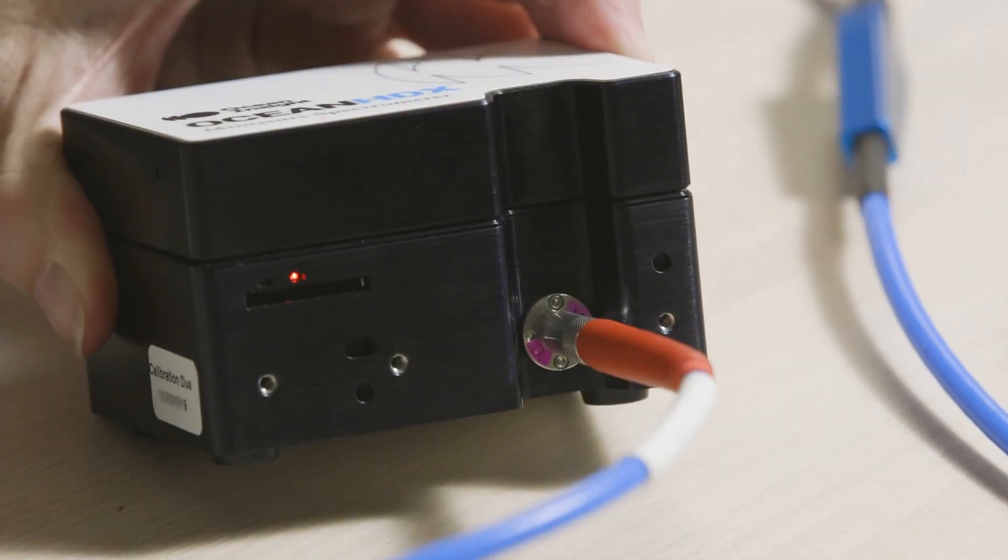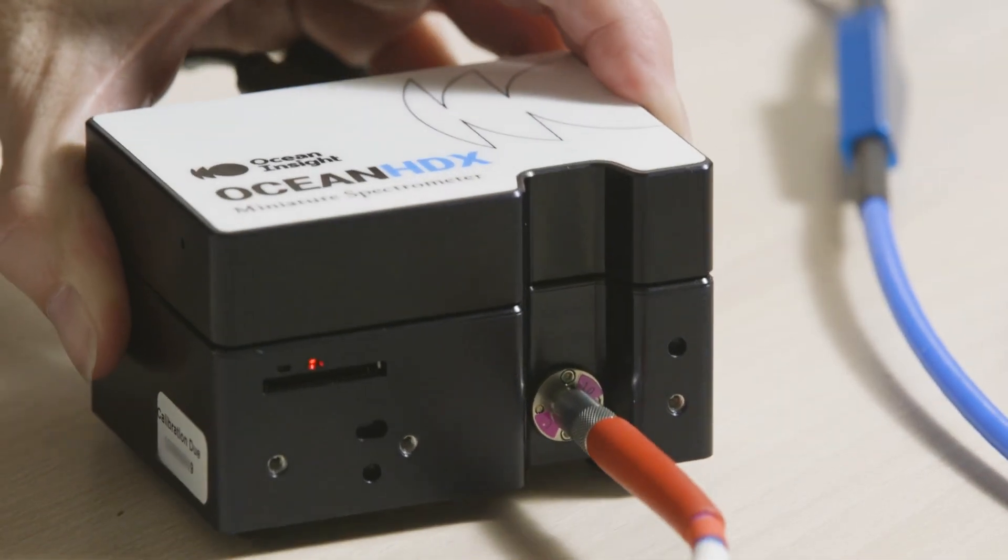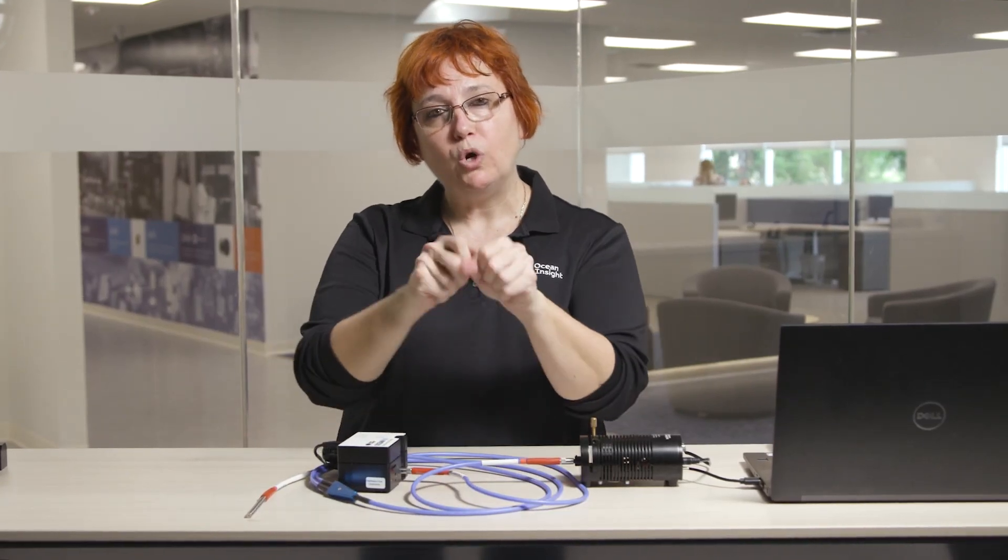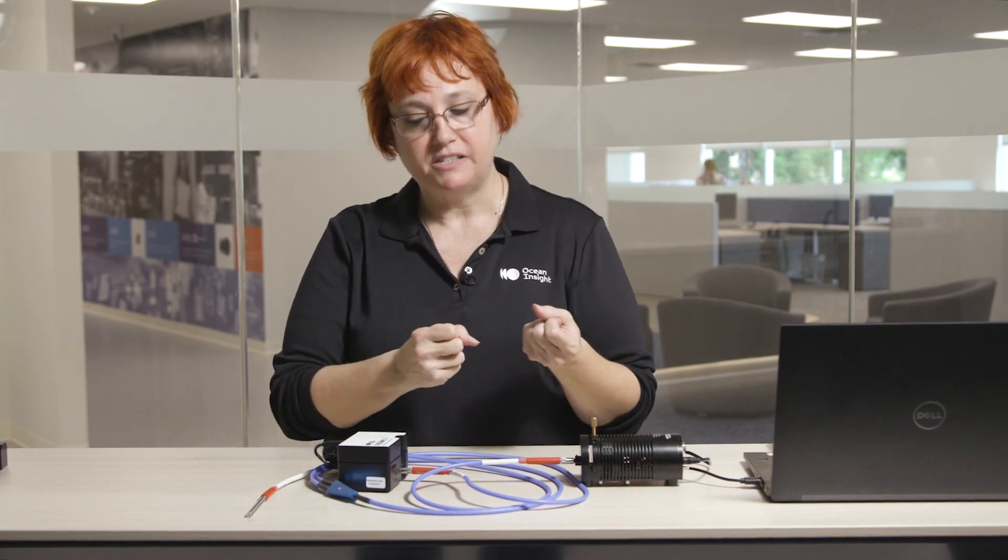One thing to keep in mind is that these are glass fiber optic cables, so you want to be mindful not to bend them or twist them too much, or you could break the fiber optics inside.